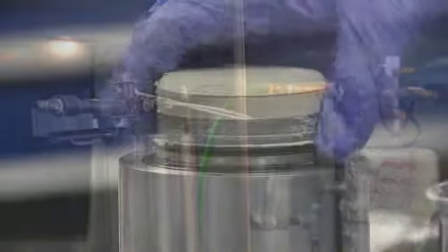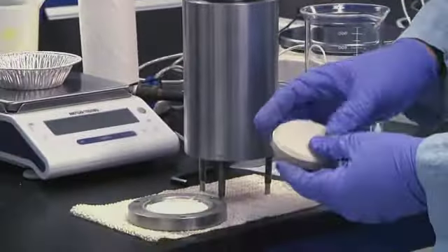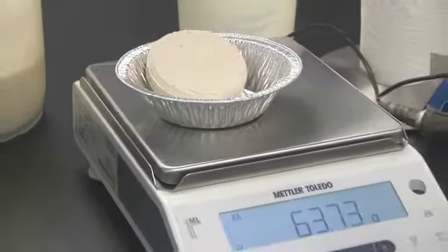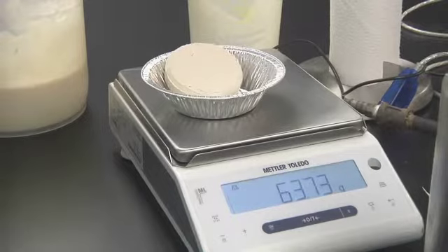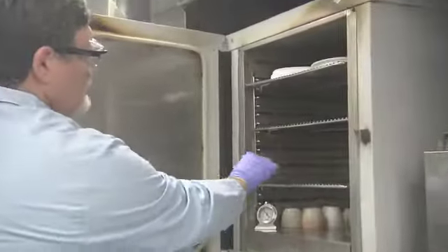The cake formed in the resistance test is evaluated for consistency and release quality from the filter media, as well as varying applied pressure, filter cloth type, and cycle time. A sludge or slurry can also be tested at varied temperatures.